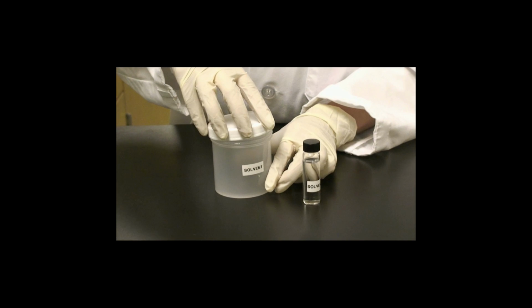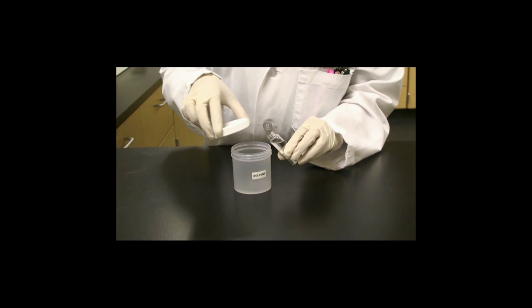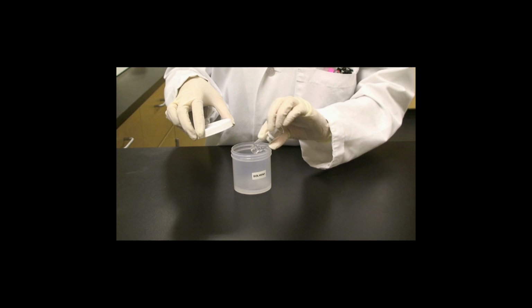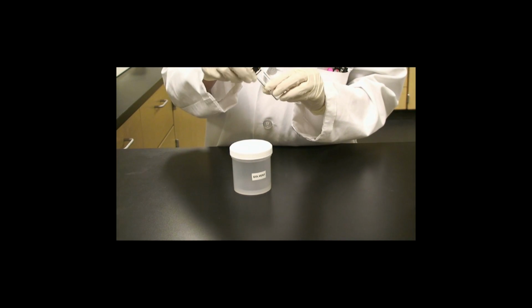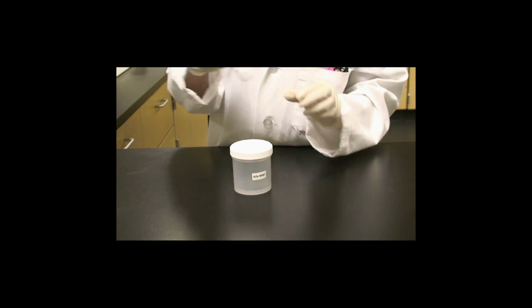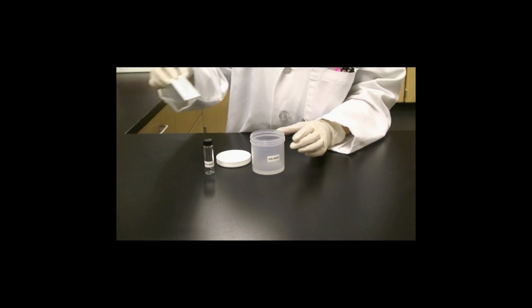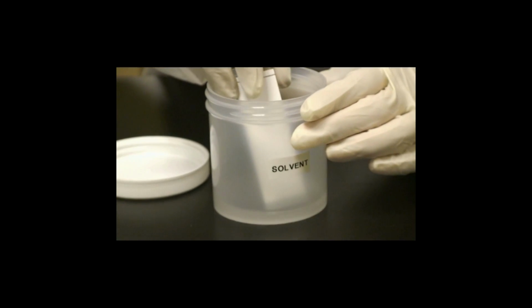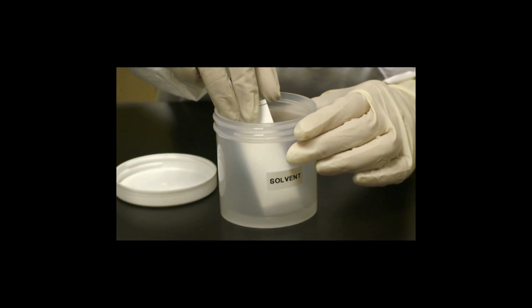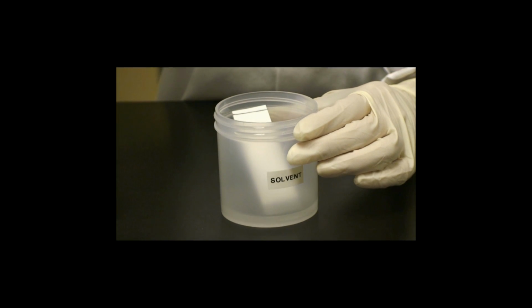While the TLC plate is drying, prepare the solvent chamber. Open the solvent chamber and add the solvent from the solvent vial, which is composed of 95% hexane and 5% ethyl acetate, both of which are commonly available from chemical supply houses. Place the end of the TLC plate containing the samples into the solvent in the bottom of the solvent chamber. Lean the TLC plate against the wall of the solvent chamber and close the lid.